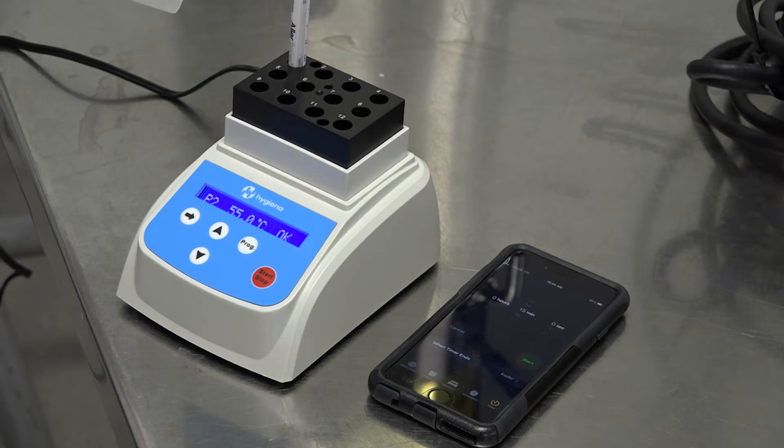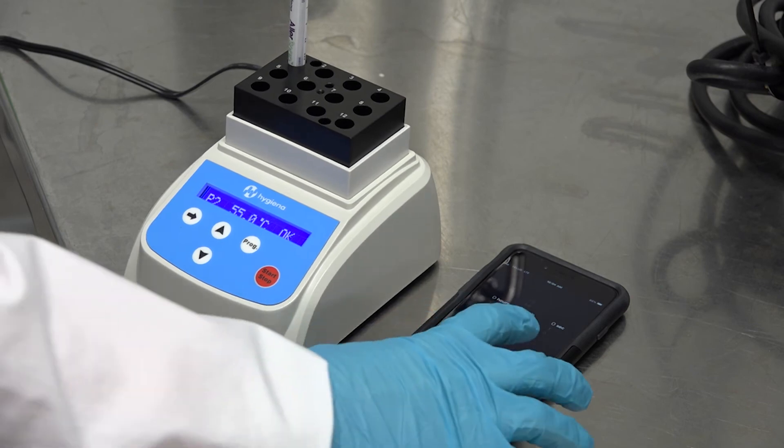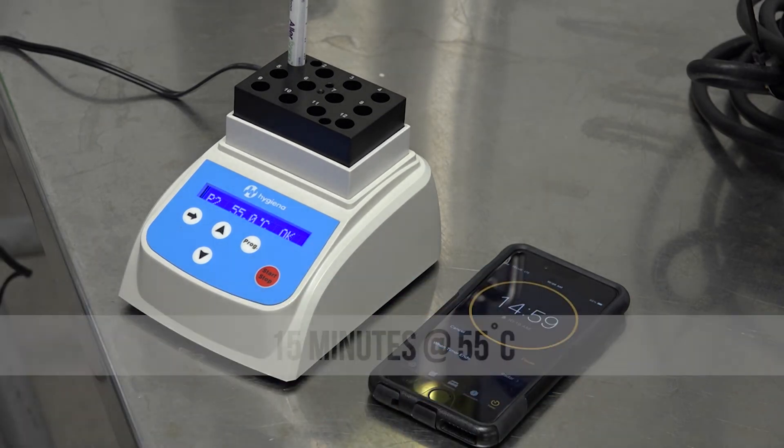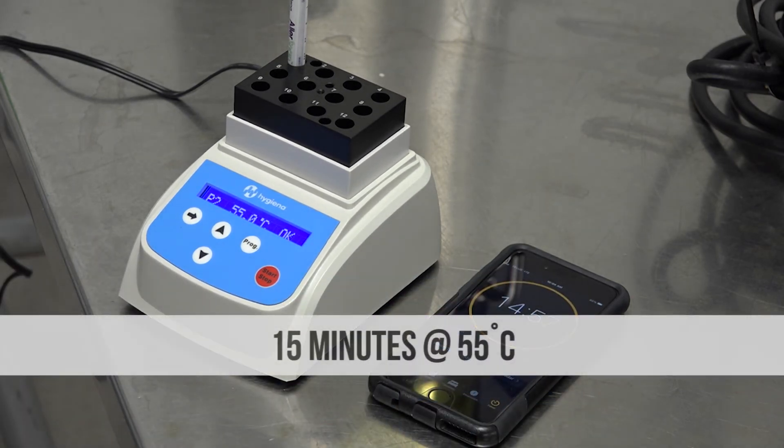Step number nine, next is incubation. Incubate the swab for 15 minutes at 55 degrees Celsius or 30 minutes at 37 degrees Celsius.